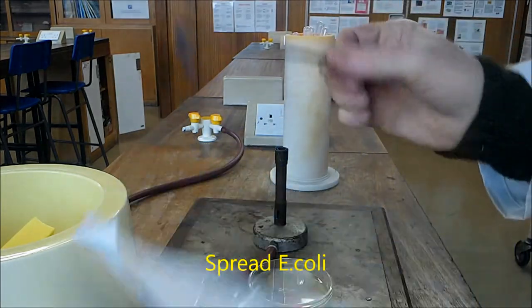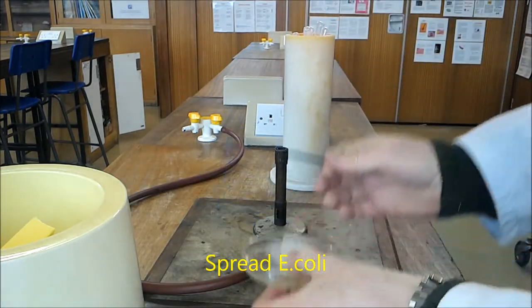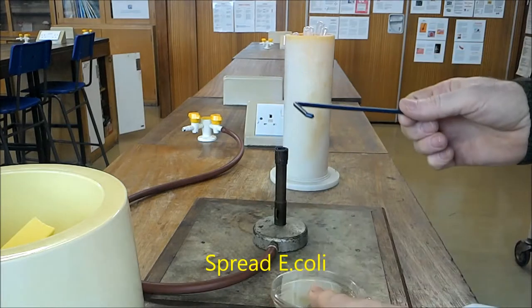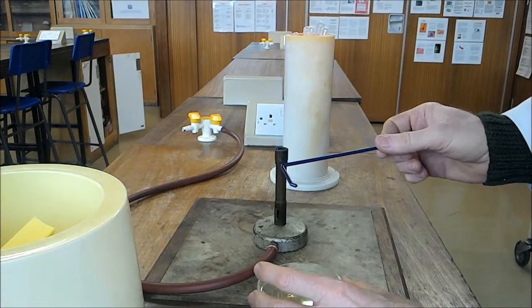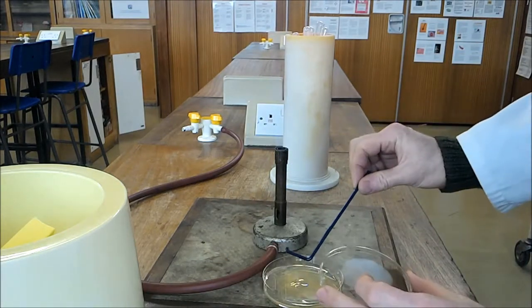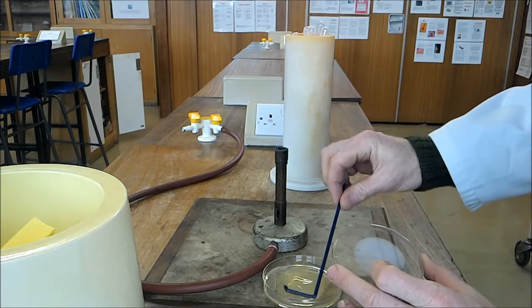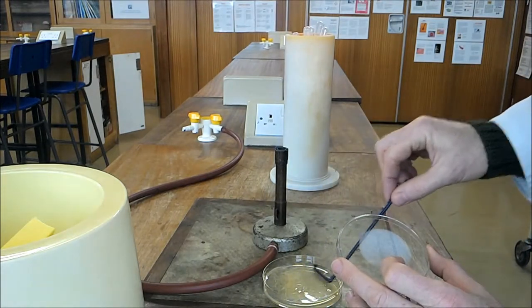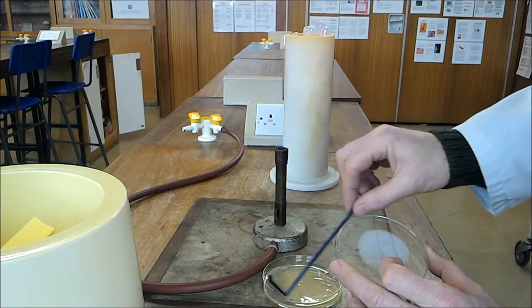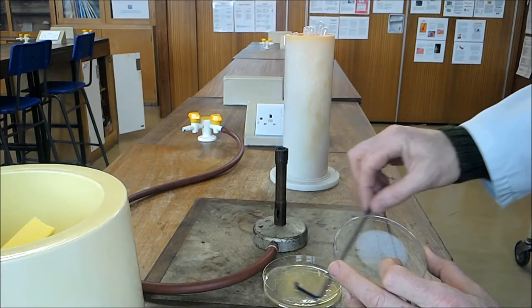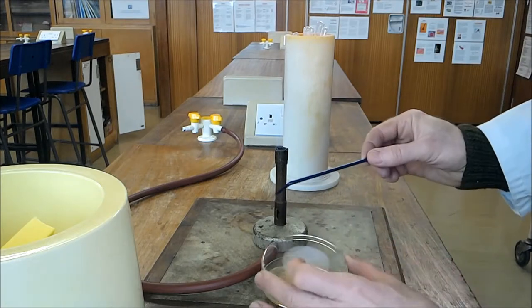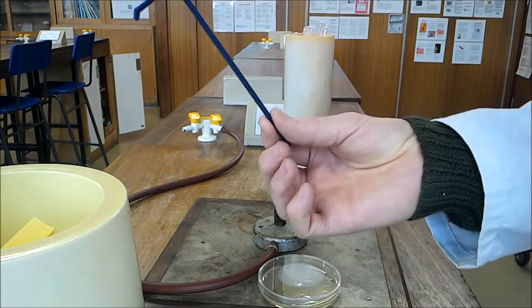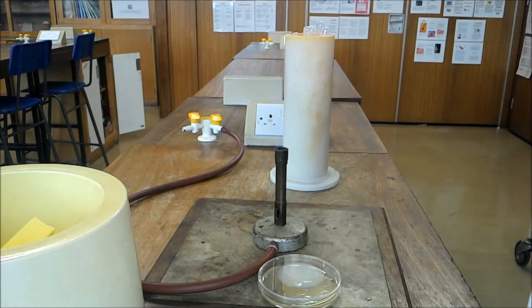Take a sterile spreader. I'm going to spread the E. coli. Take it back and forwards across the plate. There we are. And that again goes into disinfectant.